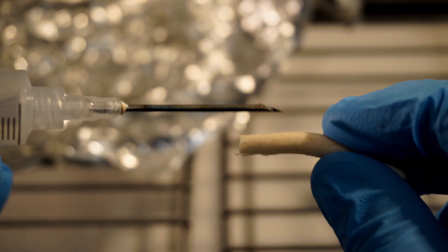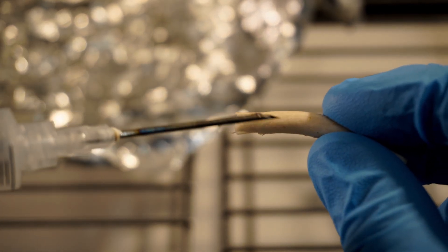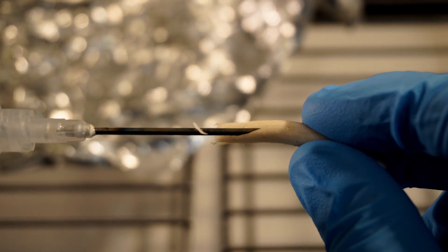This is an exaggerated example of how I'm doing it. You kind of pull so that the filament slices off on the sharp side of the needle.